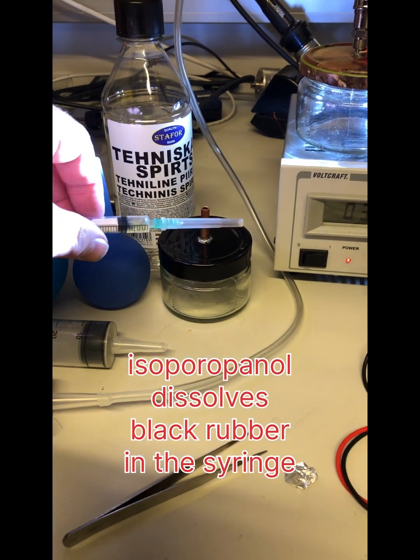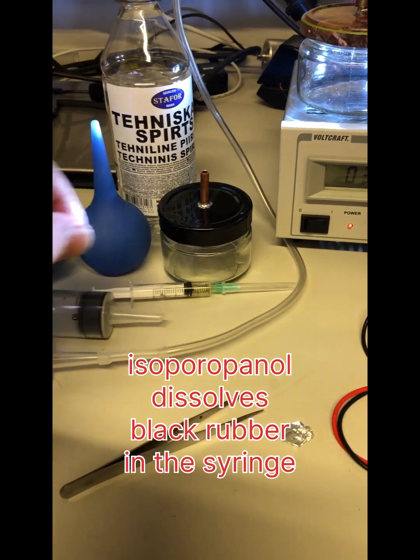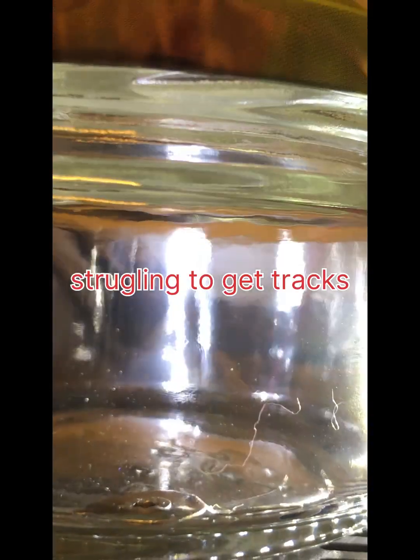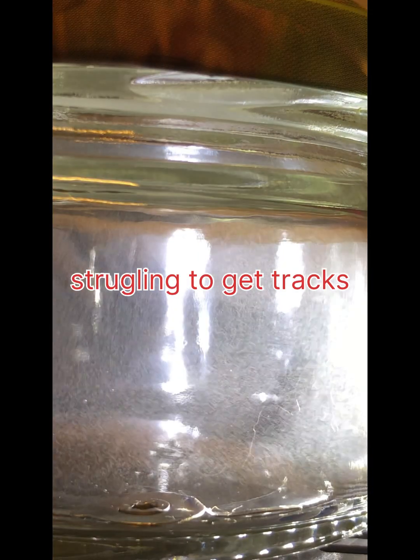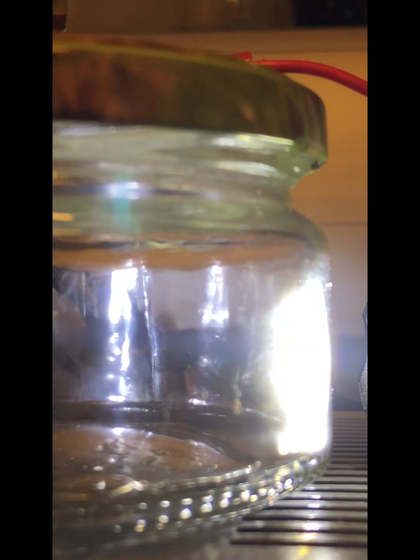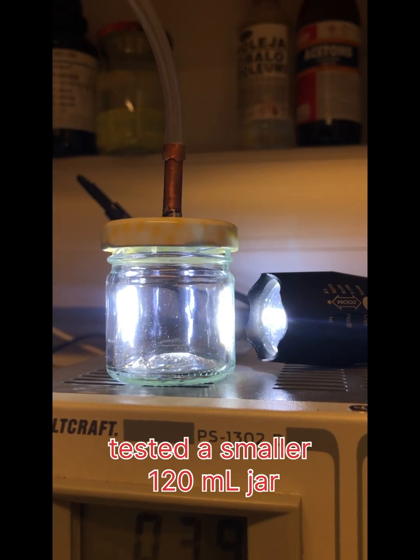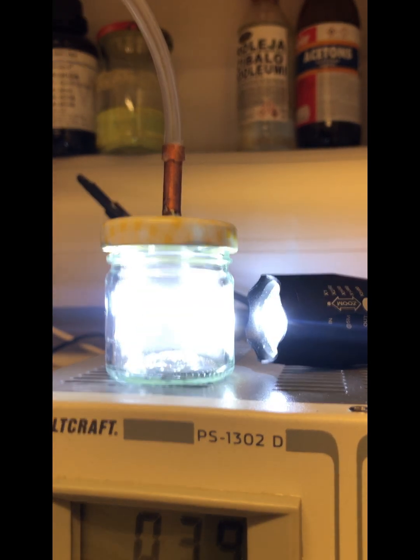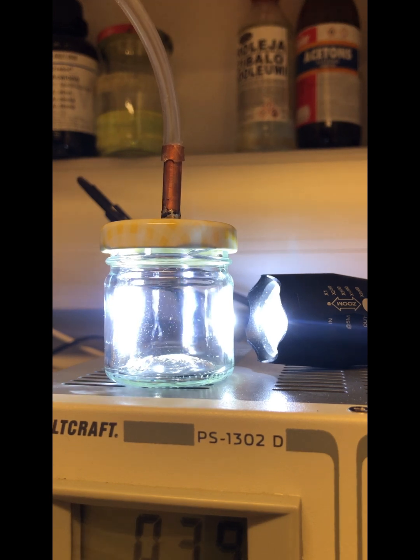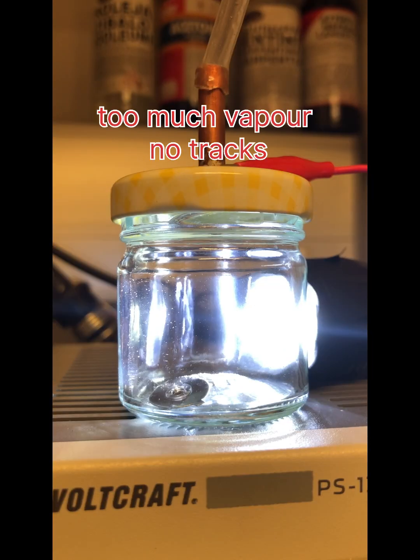For liquid I use isopropyl alcohol and put a couple of drops of it into the system. Too much is not good. A small jar. No high voltage, no tracks. Start seeing rainbow.